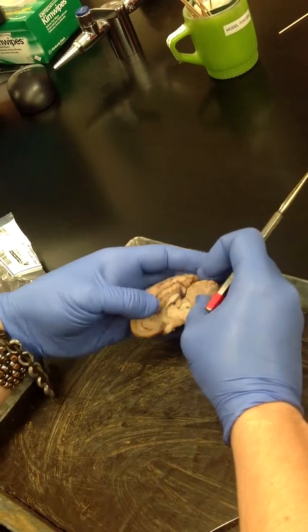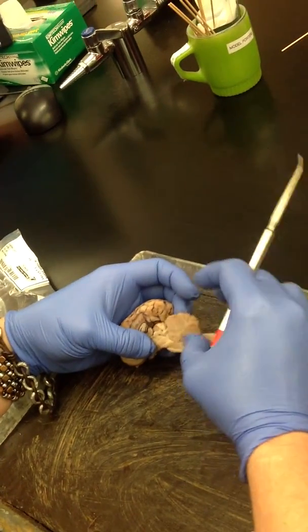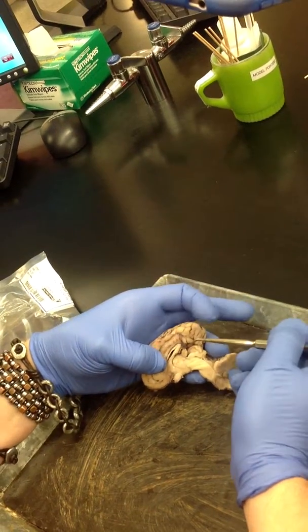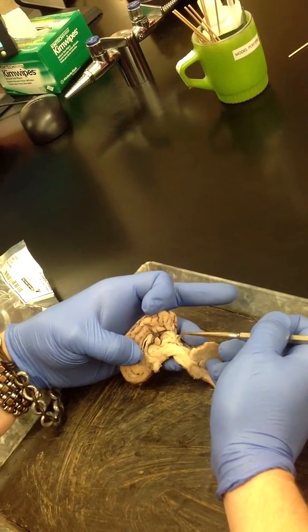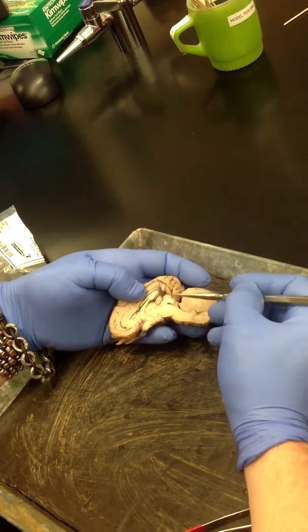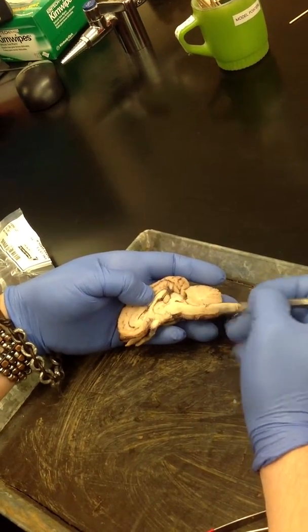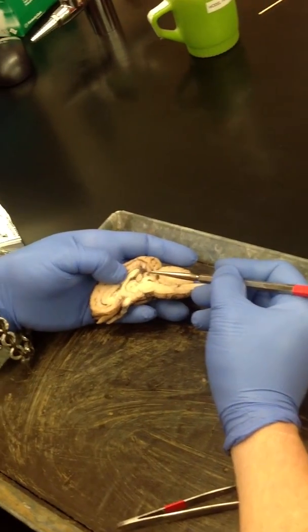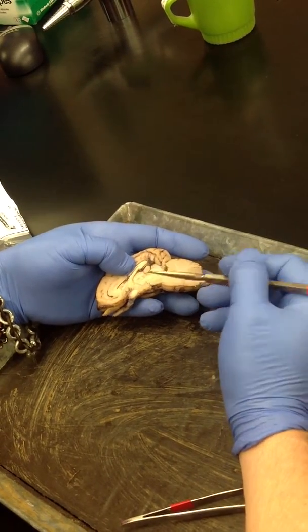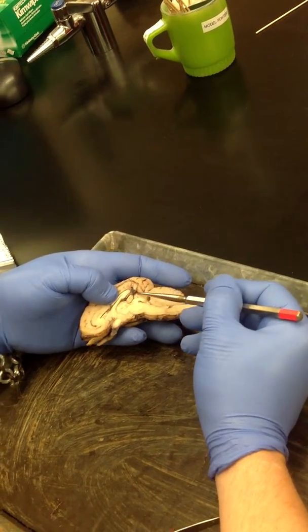And if you take the cerebellum and pull it down, you can see the colliculi really nicely. So you've got the superior colliculi and the inferior colliculi. And those colliculi are part of the midbrain, or the mesencephalon. I always look for the superior colliculi, and right above it will be the pineal gland. Different brain regions, but I use it as a point of reference. Pineal gland is in the diencephalon, colliculi are in the mesencephalon.